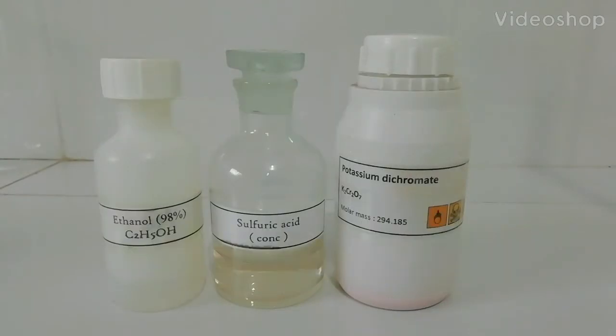Welcome to my YouTube channel. Today we are going to make chrome alum. Chrome alum is a combination of two sources: chromium sulfate and potassium sulfate.